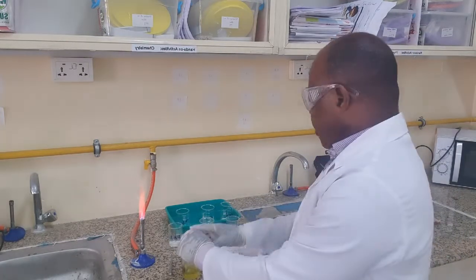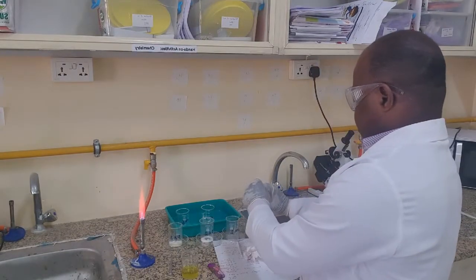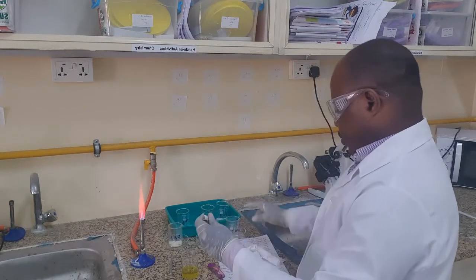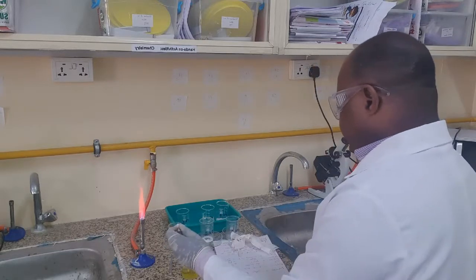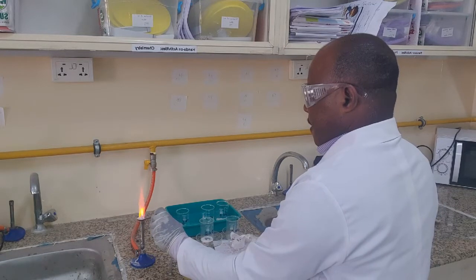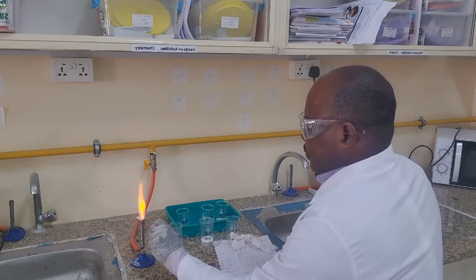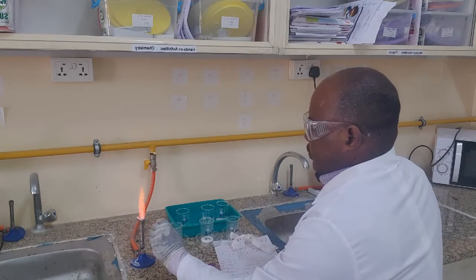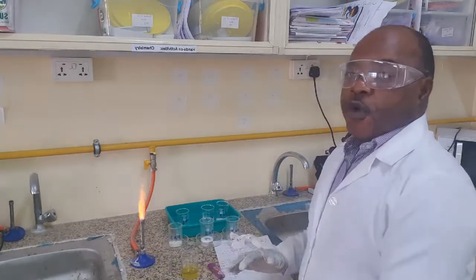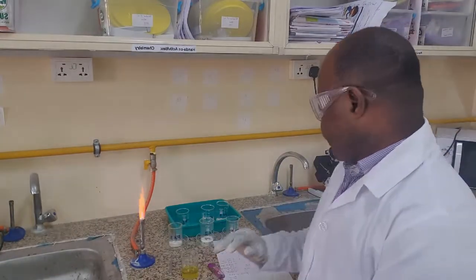Let's go to Fa4. Fa4 gives us no distinctive color.